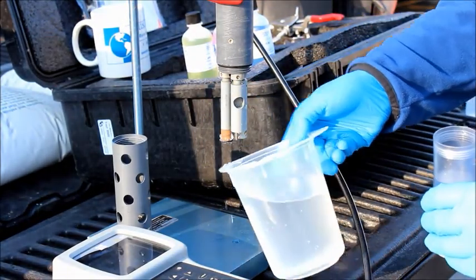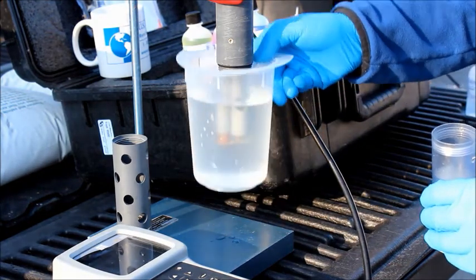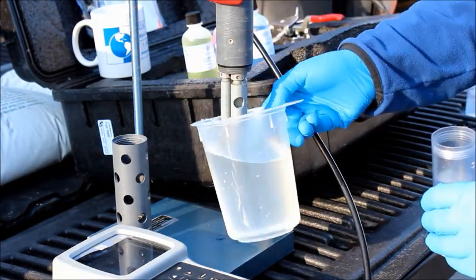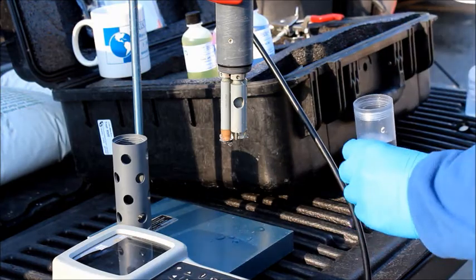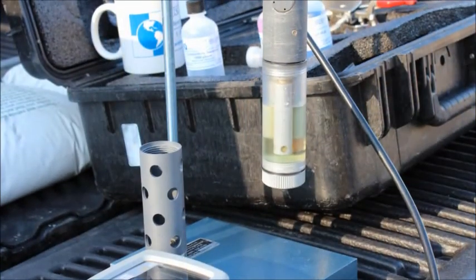Before calibrating a new sensor, remember to briefly rinse all of the sensors to remove the previous calibration solution. Following a calibration checklist will ensure that sensors are calibrated properly every time.